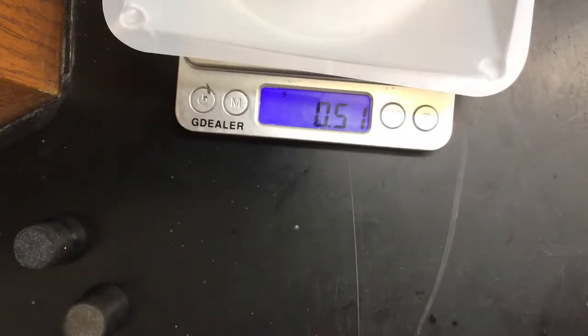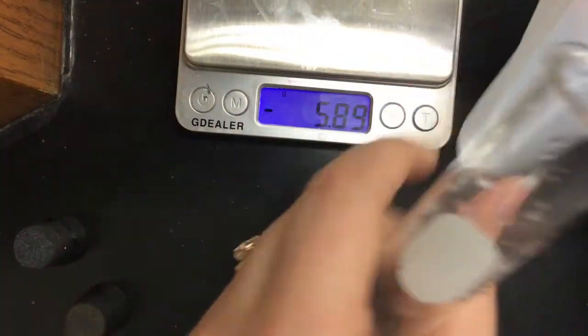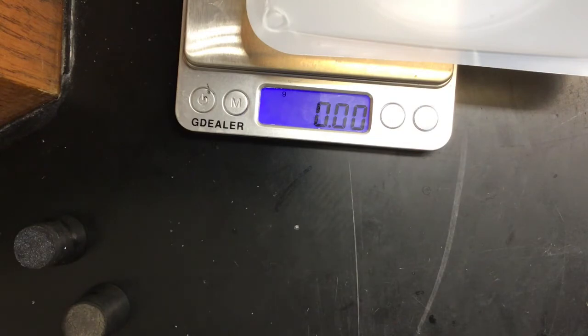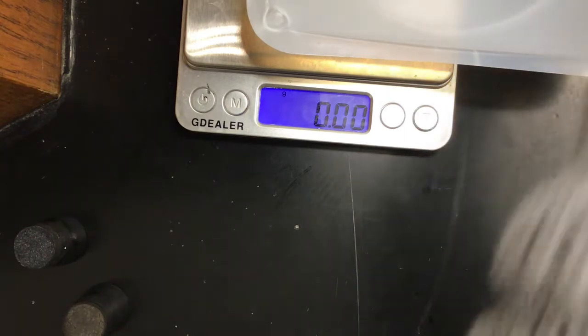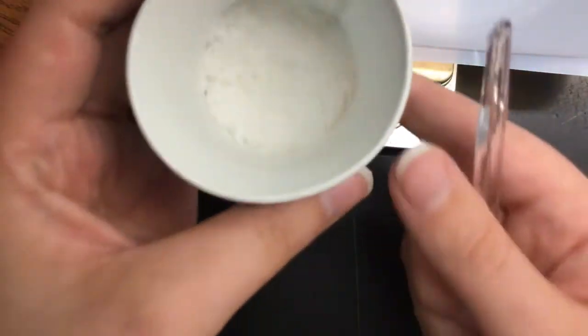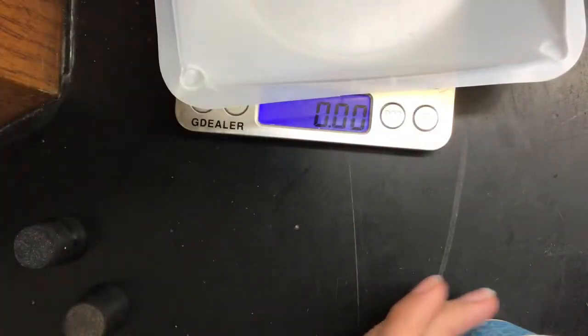So what I'm going to do now is pour it into my test tube. My test tube is a little bit wet, but that's fine because I'm gonna add that water. So I pour that in. I'm going to set this aside for now because I'm going to prepare my other test tube. So my next test tube is going to have my molecular. So here is my molecular, and it's the same one that we used in the last lab with the microscope.